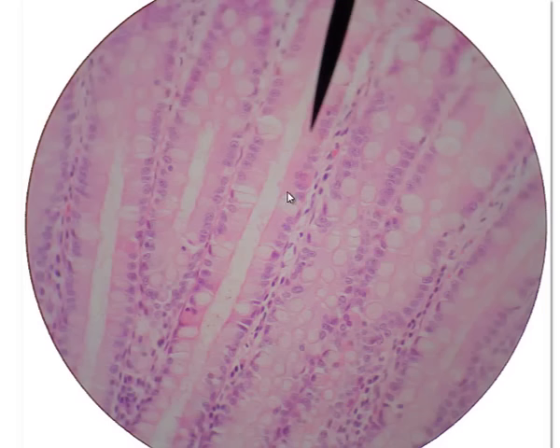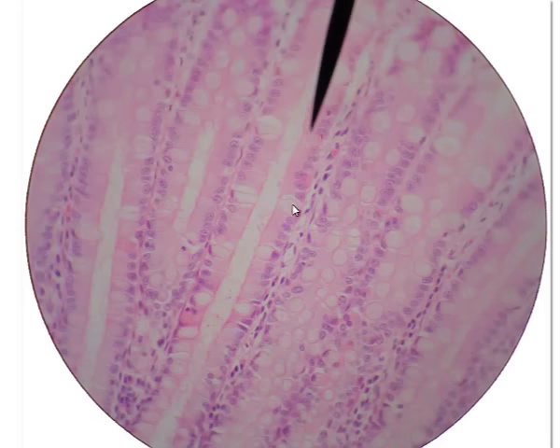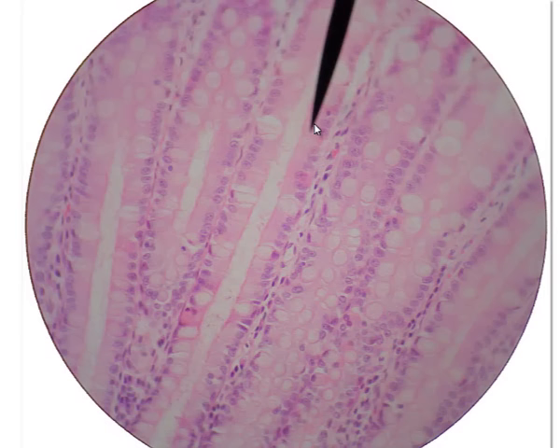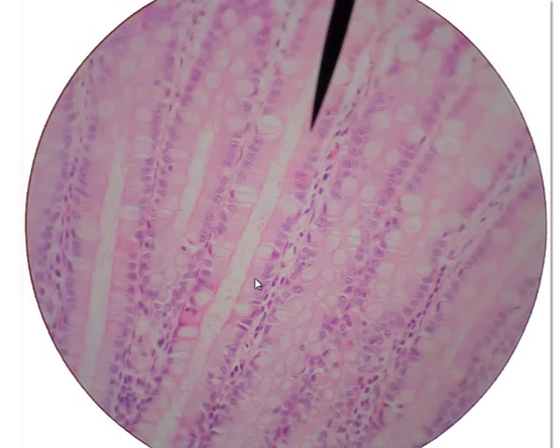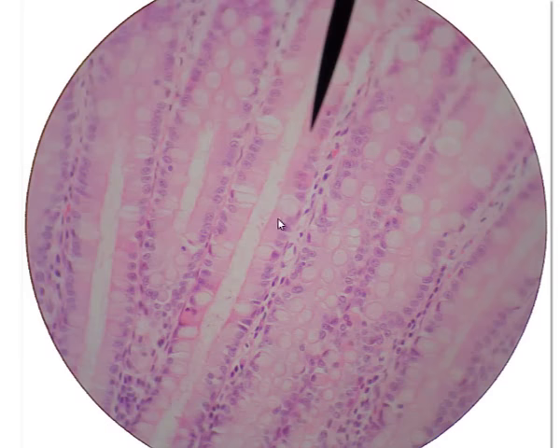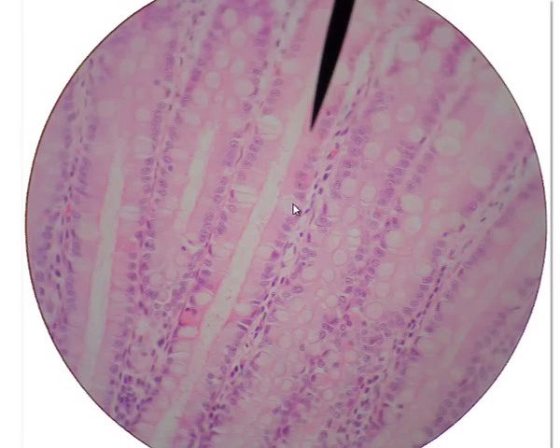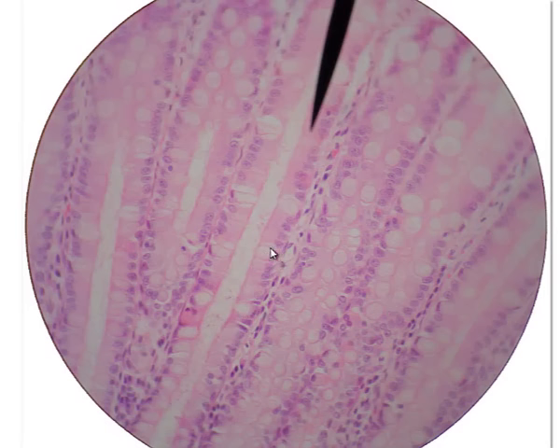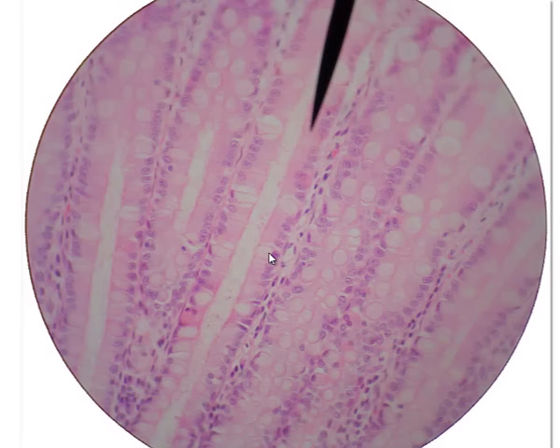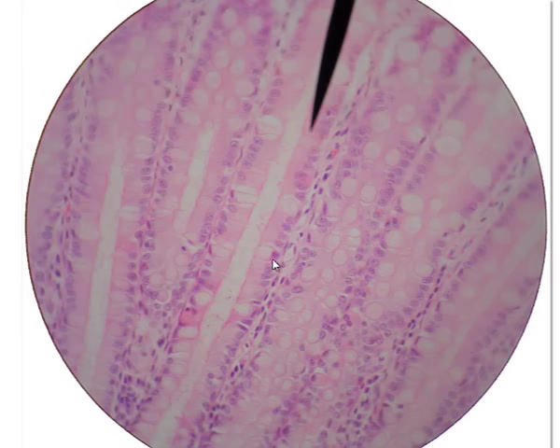This next slide is from the gut — I think this is small intestine. Look at this line of cells. We have one layer here and those cells are taller than they are wide, so this is simple columnar epithelium. There's another type of cell in this image: these whitish cells are called goblet cells, and they produce mucus for the digestive tract. You often see goblet cells in pseudostratified columnar epithelium as well, because goblet cells also make mucus for our respiratory tract.